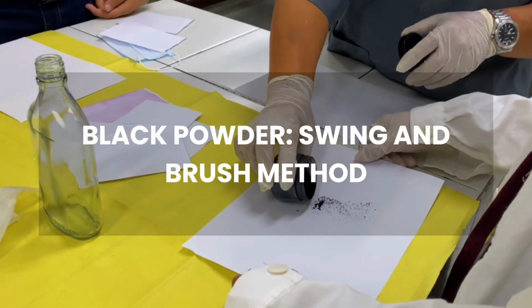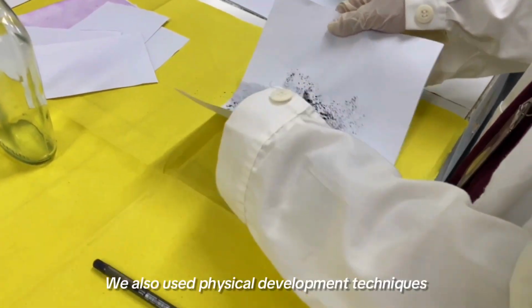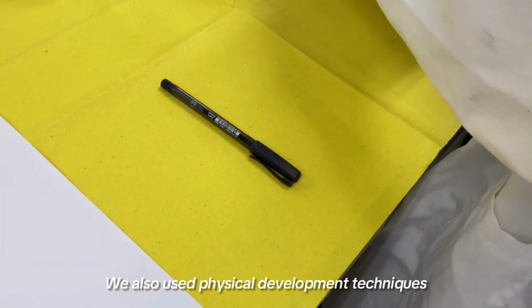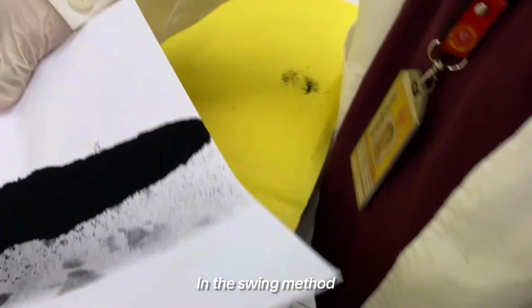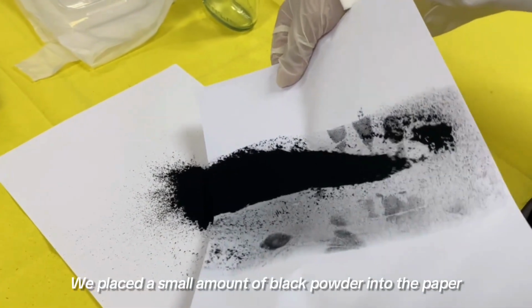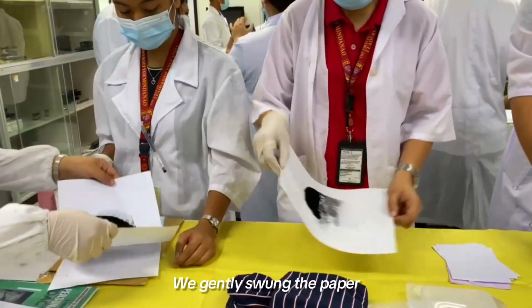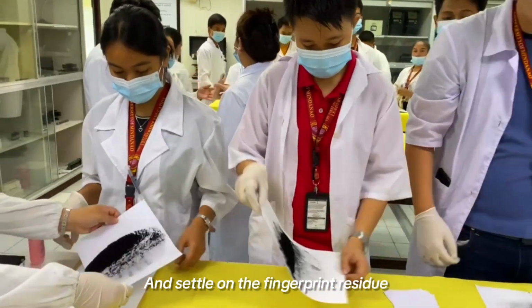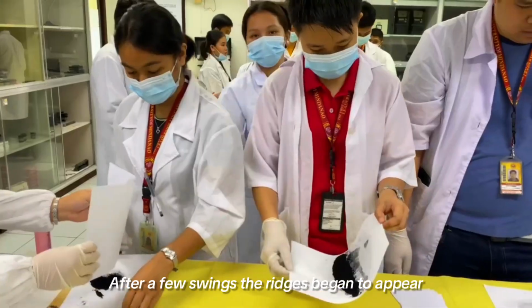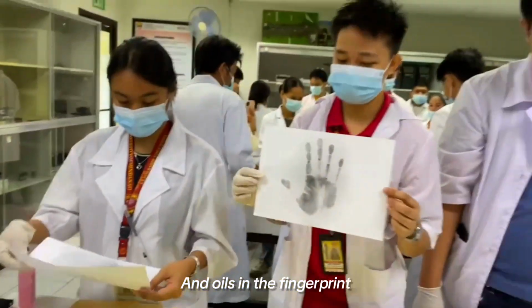Black powder, swing method and brush method. In addition to chemical methods, we also used physical development techniques with black fingerprint powder. In the swing method, we placed a small amount of black powder into the paper containing the latent print. We gently swung the paper so that the powder would disperse and settle on the fingerprint residue. After a few swings, the ridges began to appear as the powder adhered to the moisture and oils in the fingerprint.